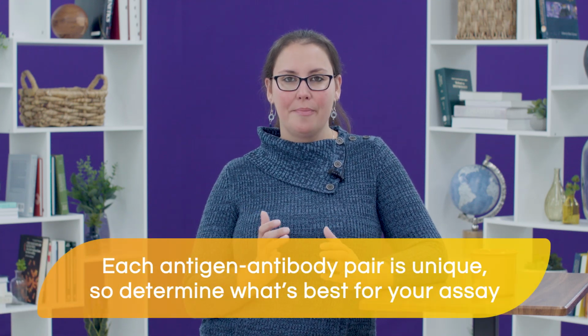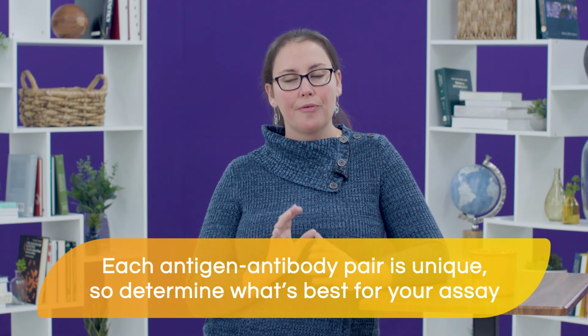Some blocking agents are known to be more stringent than others, meaning that they provide a more efficient coverage of the membrane, leading to less background. However, each antigen-antibody pair is unique, and they will perform better with different blocking agents. So you will have to empirically determine what will be the best blocking for your particular assay.